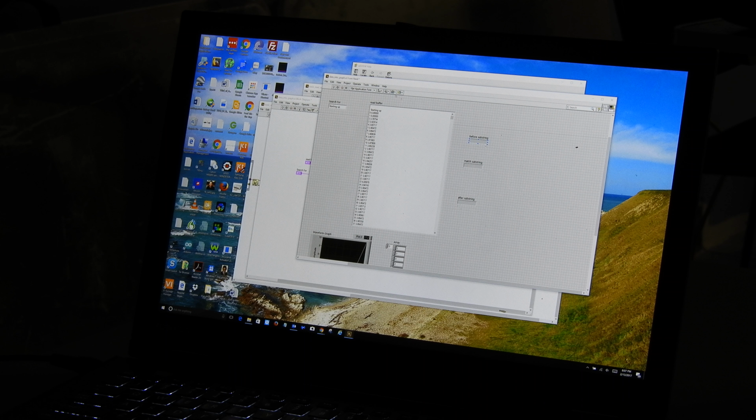Give me the thing. It's really not wanting to give this to me. There it goes. All right, and here's the after. All right, so now when I run it, let me just save it real quickly. Boom, there we go. Here's the match substring. It found this starting up. It says, look, I found it. Here it is, starting up. And here's what came after it. And this is really good because it has all of our numbers.